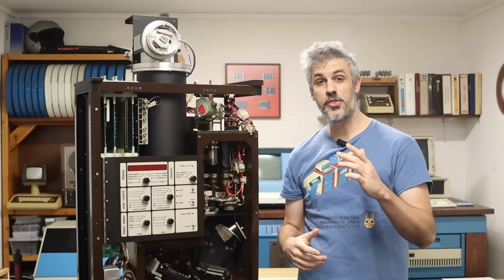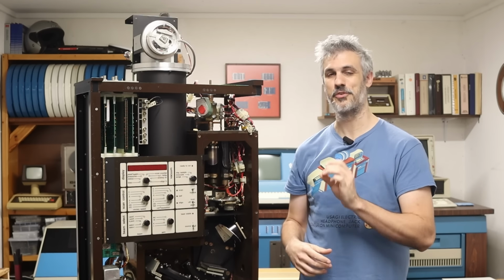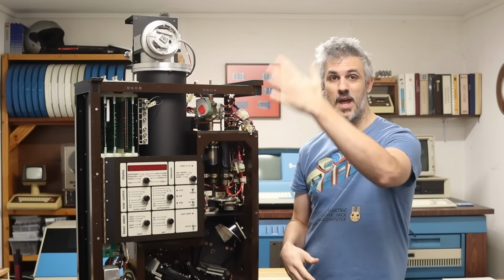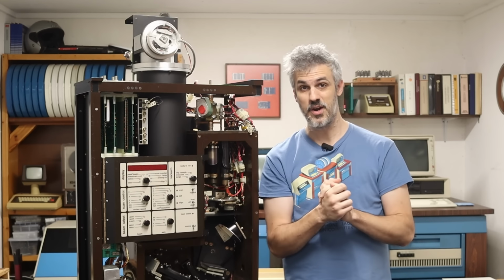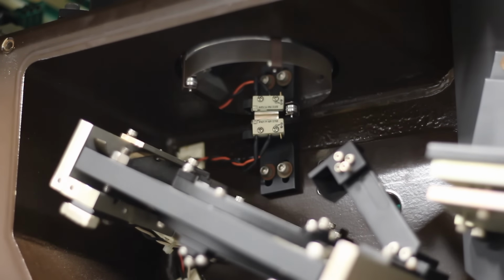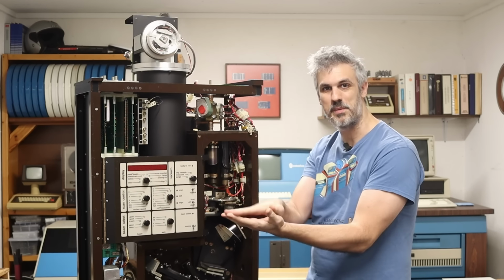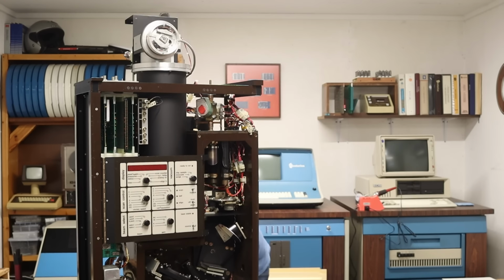All right, moment of truth. That's kind of a dire modification that we did on the back, and it's also not my prettiest work. But what we want to see is the motor come to life and the mirror start to move. What we don't want to see is everything catch on fire. So I've got a second camera set up here looking at just the movable mirror. Hopefully, whenever this thing is in the proper idle state, that mirror should be going up and down on repeat. So let's flip the switch and see if that happens.